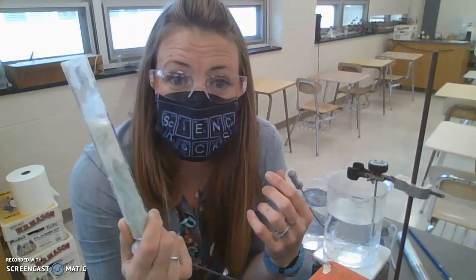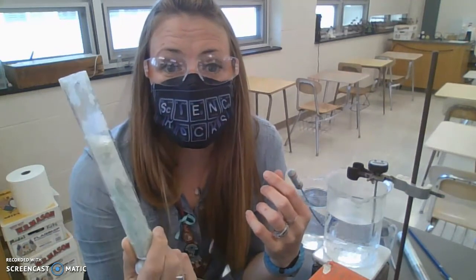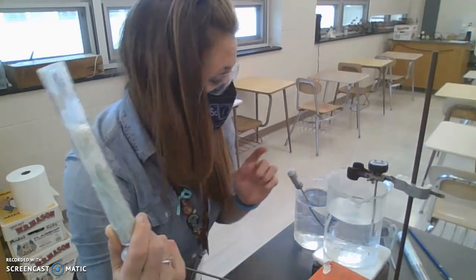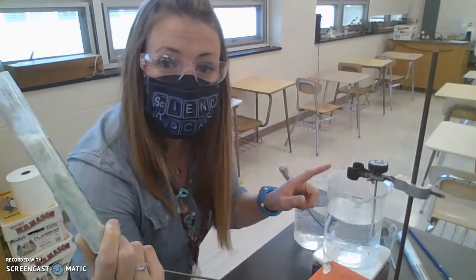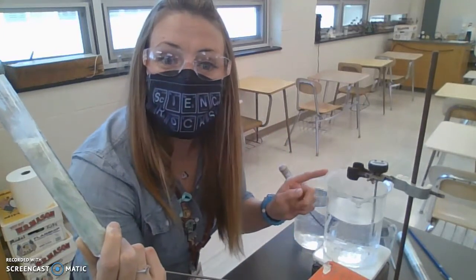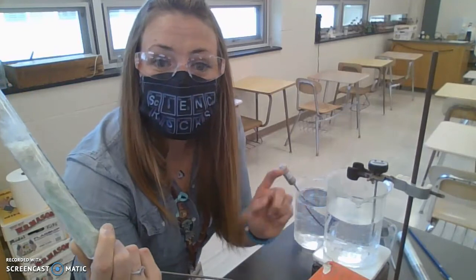What we're going to figure out is the freezing and melting point by looking at the temperature changes as it is melted and as it is frozen.